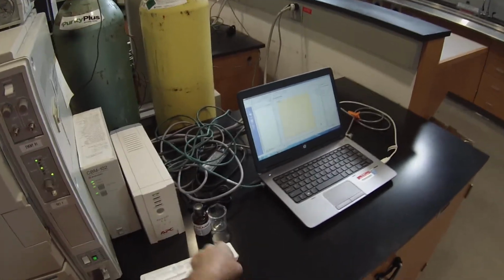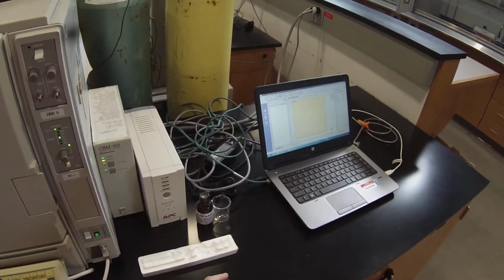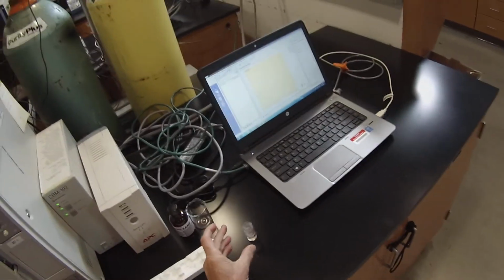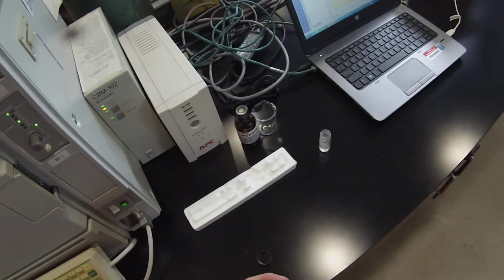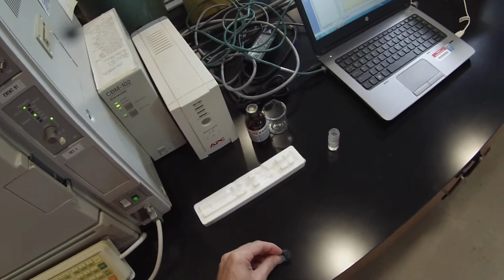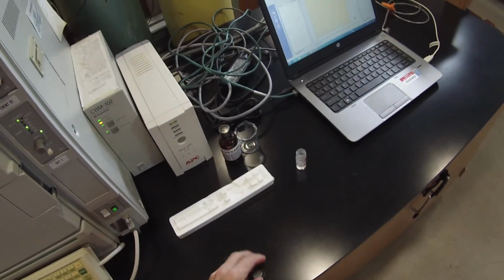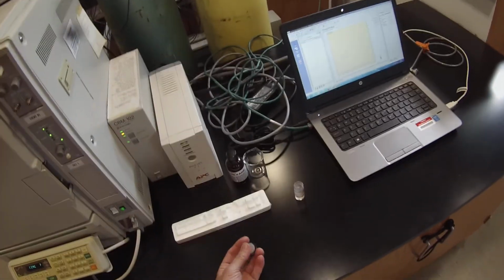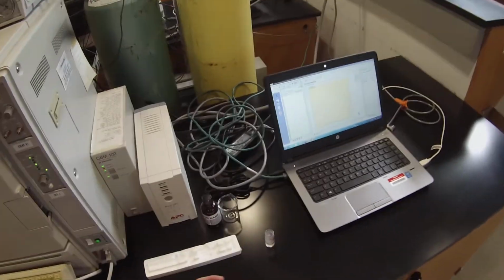And I'm going to try to put the cap back on there without knocking it over. In one hand. Yeah, that failed. Teflon side towards product. Because I don't want this to evaporate in case I need to make another injection. Test my one-handed skills here.